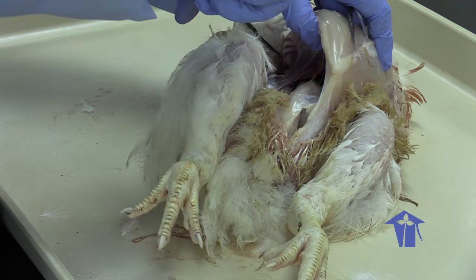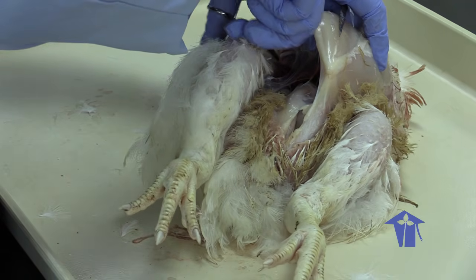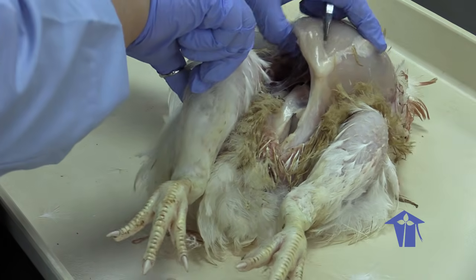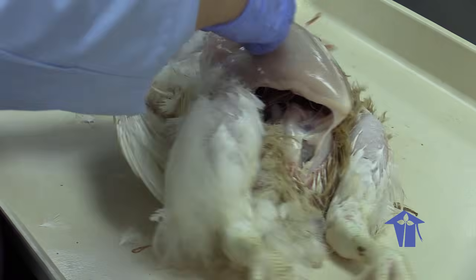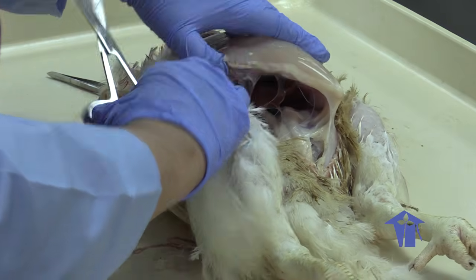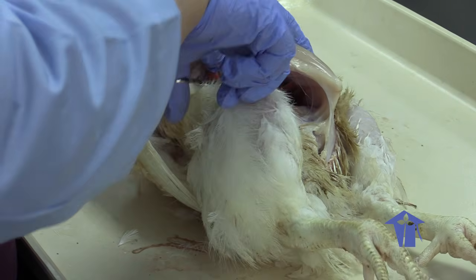Now, of course, if you are a meat eater, something you could do is buy one of these and cut them open, or buy a fish and cut it open to just get an idea of what it is that goes into making an animal function in food acquisition and processing.